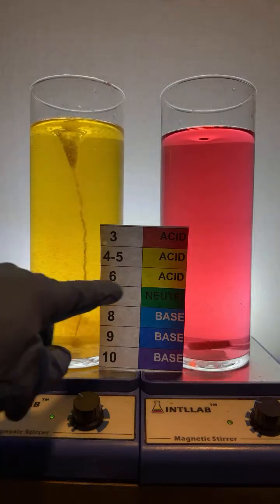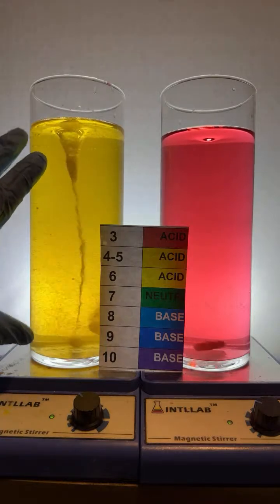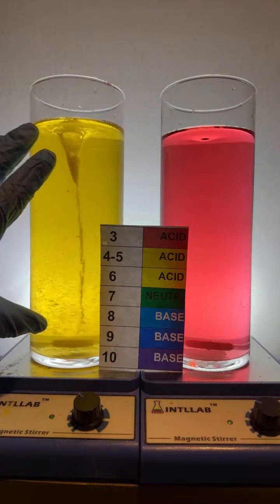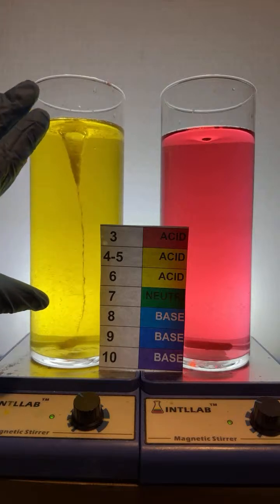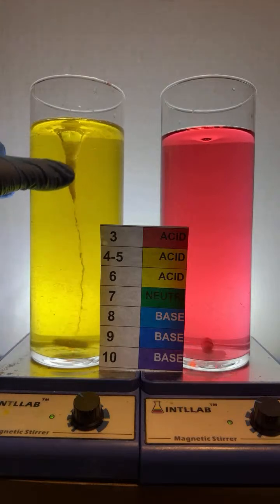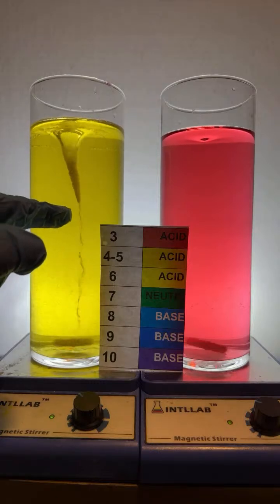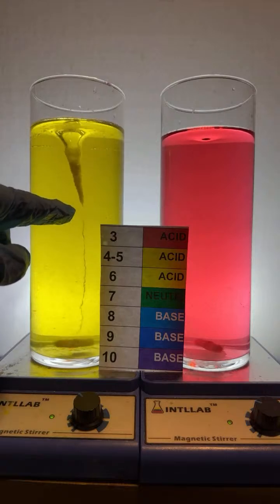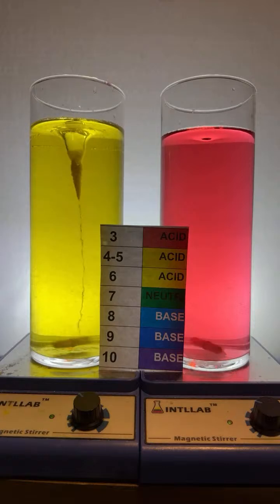And notice our pH is 6. I'm very used to seeing this when I put an Alka-Seltzer tablet in the system. What happens is the system gets buffered, we say, to pH 6. And what that means is that this is going to resist changes in pH, because this contains both an acid that will react with any base that I add, and it also contains a base that will react with any acid that I add. Here, let me show you.